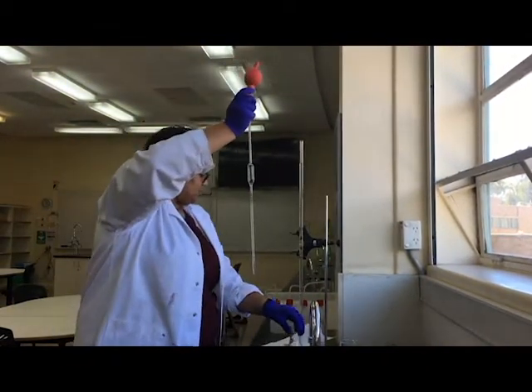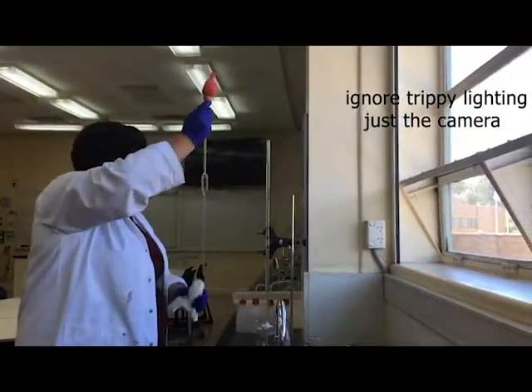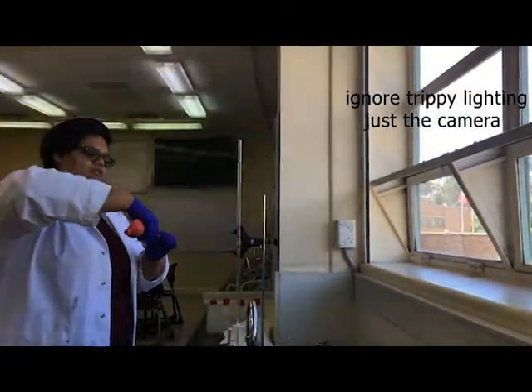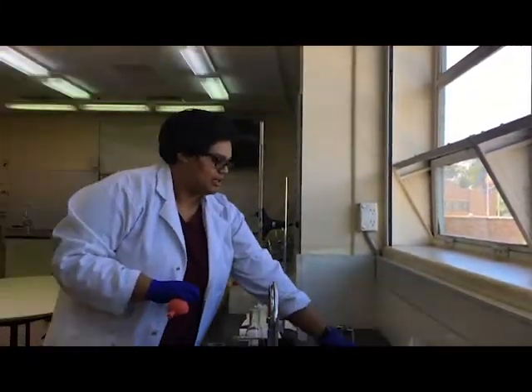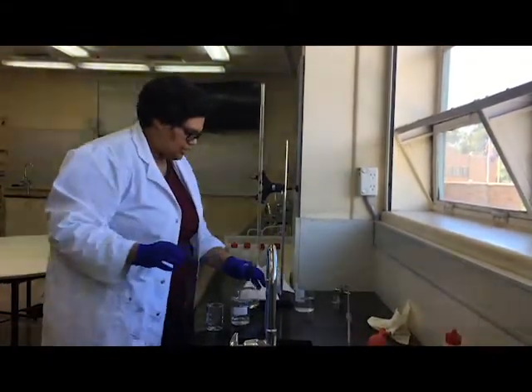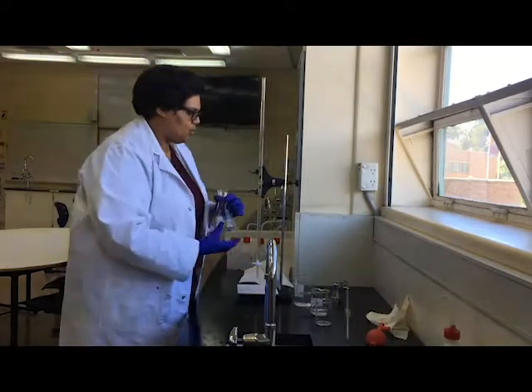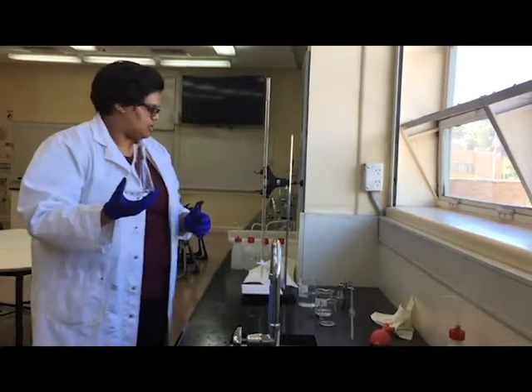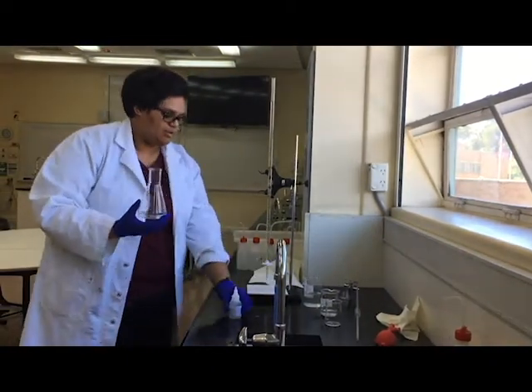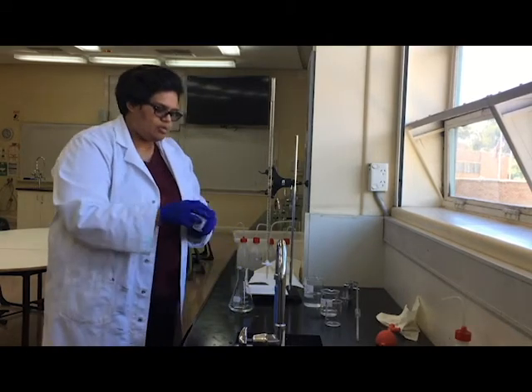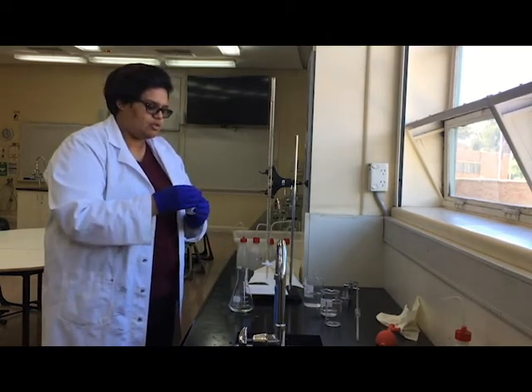Okay, there we go. So I'm just going to wipe the outside again. I'm going to take my bulb off by twisting it and lay it back down. So now that I've got my acid in here, I'm almost ready to go. I'm doing an acid-base titration, which means in order to see the endpoint of the reaction, I'm going to need an indicator. I'm using phenolphthalein. I'm only going to put about two drops of phenolphthalein, don't want to put too much.